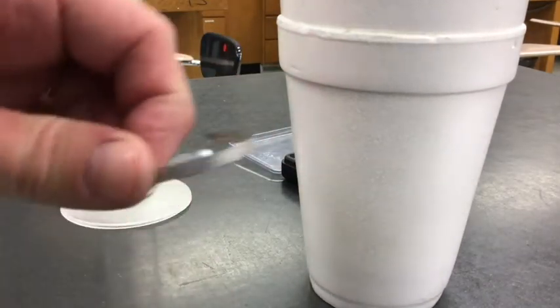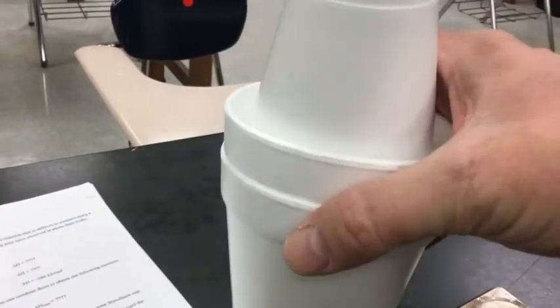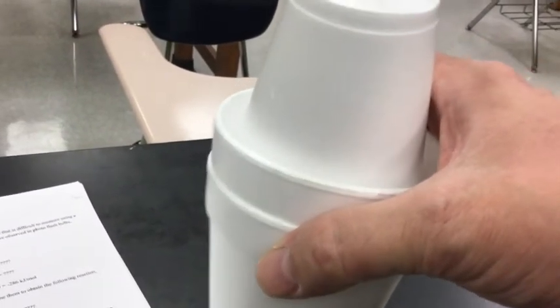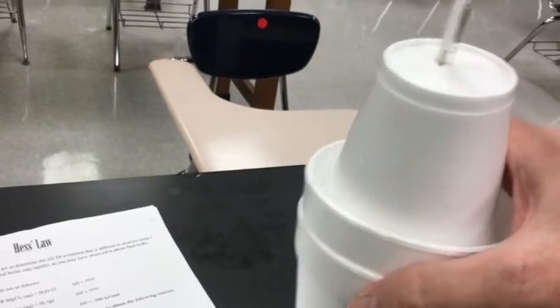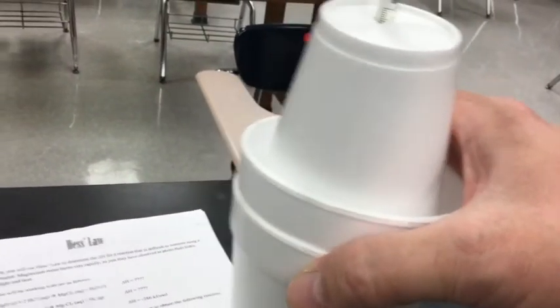So I got my lid, I've got my magnesium here. I'm going to dump in my magnesium and put in my thermometer, and I am going to give that a shake, shake, shake, and give that some time to react here. So I've got 50 grams of water essentially that is absorbing whatever amount of energy is coming from the magnesium and hydrochloric acid reaction. As soon as that is done reacting, the temperature will stop going up. I'll take the lid off, and then we can figure out what the final temperature is.